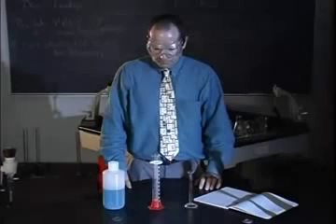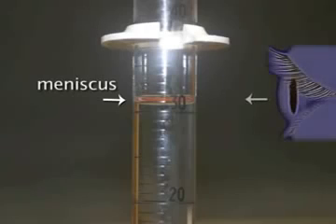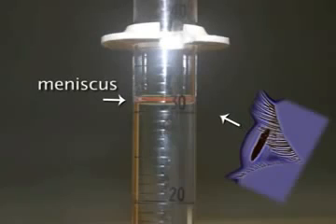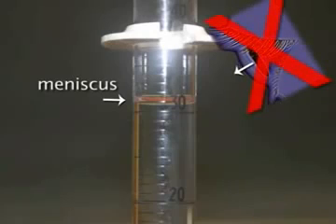In the general chemistry laboratory, we will typically measure liquids using glass vessels. Liquid has a curved surface in glass called a meniscus. The volume of liquid is measured from the bottom of the meniscus. The eye must be horizontal with the bottom of the meniscus to avoid errors due to parallax. Parallax refers to the apparent shifting of an object when viewed at different angles. If you view the same meniscus from different angles, the perspective will change.